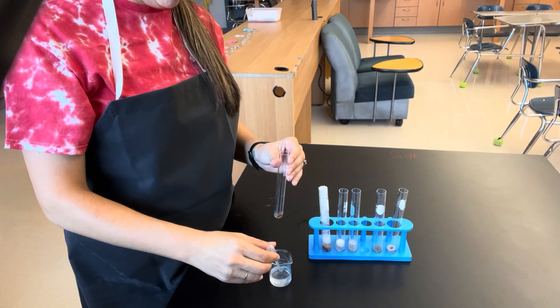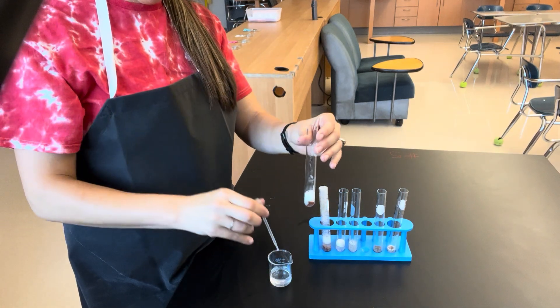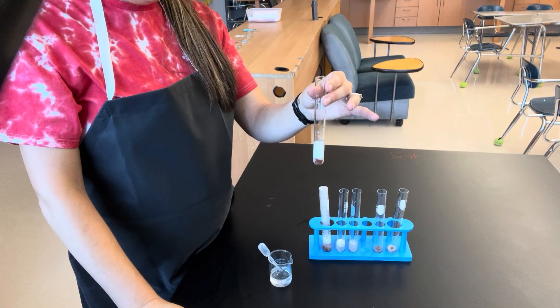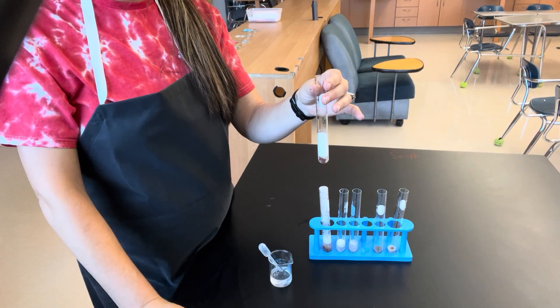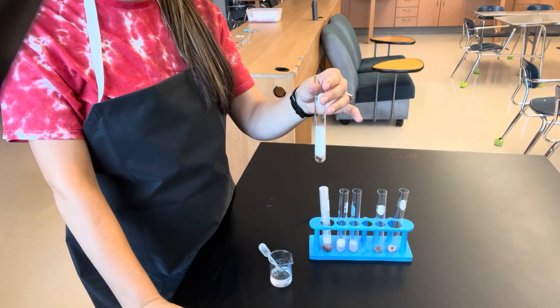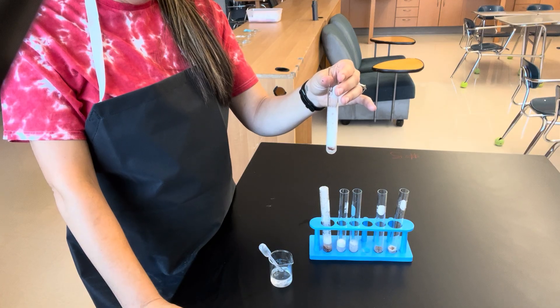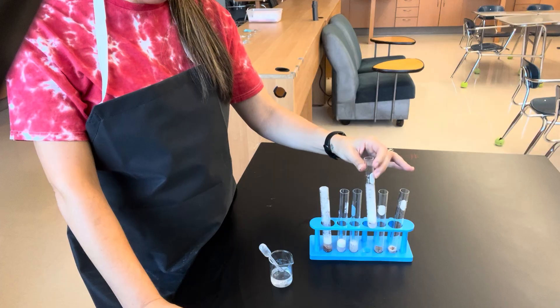Now we're going to look at frozen liver. As you can see, we're bubbling, which means the enzymes are working — they are forming that reaction with the substrate. We're still going, so we're going to let that one sit.